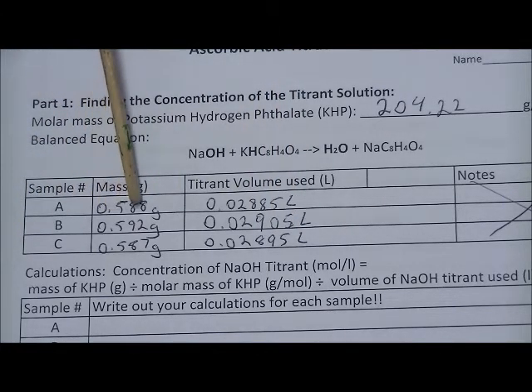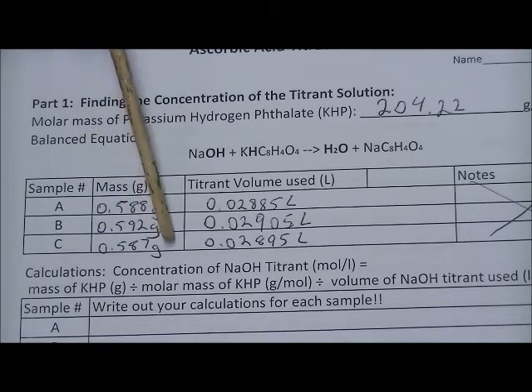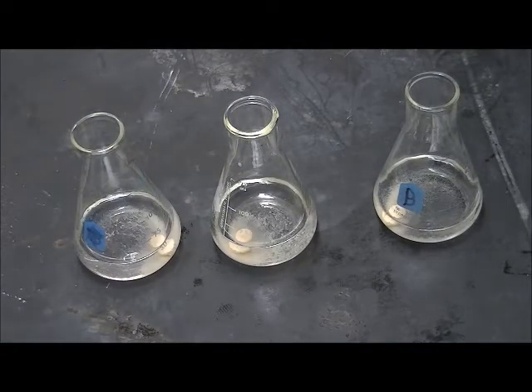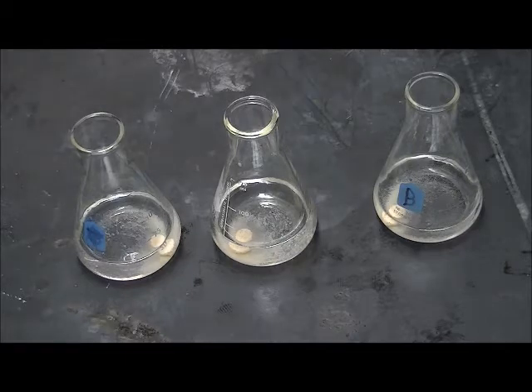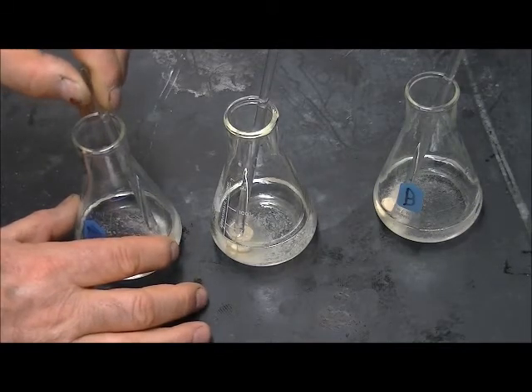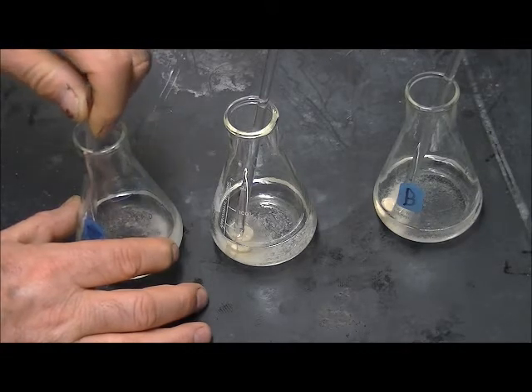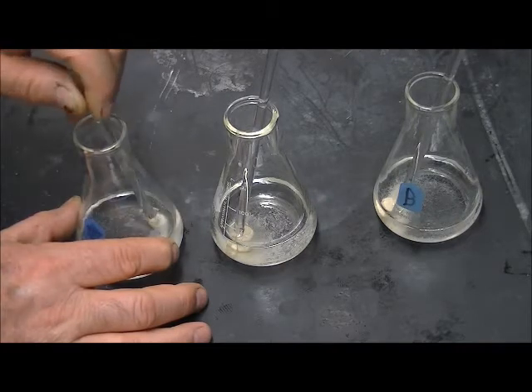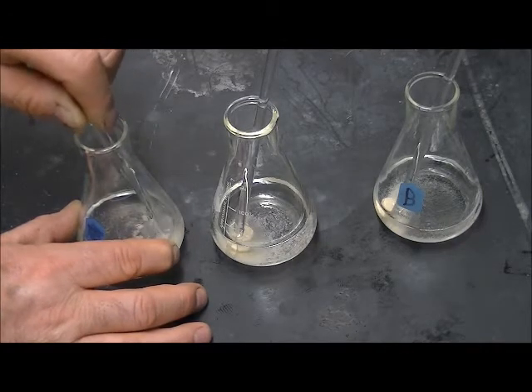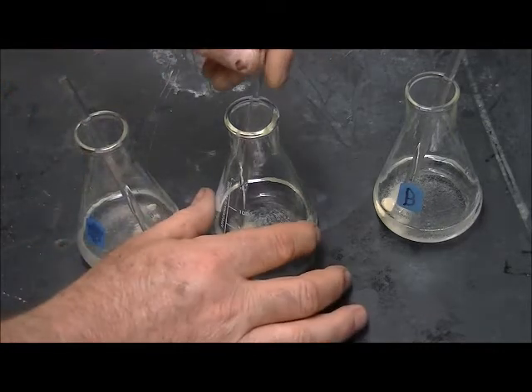The tablets have been sitting for 15 to 20 minutes. I have a glass rod to help break them up and further dissolve the ascorbic acid out of them. The tablets themselves contain a lot of binders and other materials that do not dissolve, so there will be solid left in the flask even after all the ascorbic acid has been released. I'll continue to break these up.